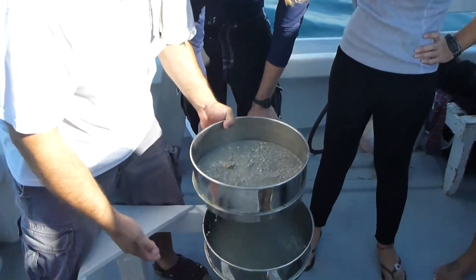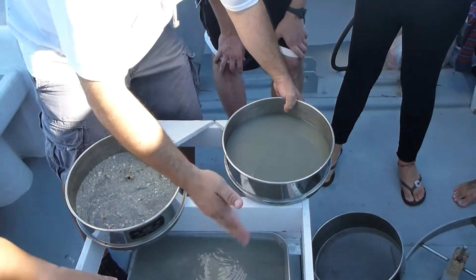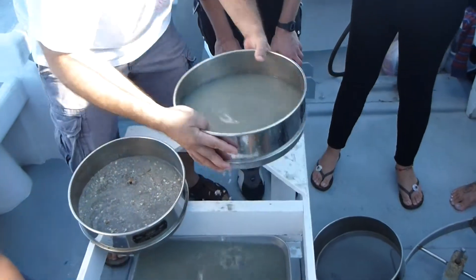So I have to keep that in mind, because what's the point of filling it up? So now what do we do? We're just tapping.